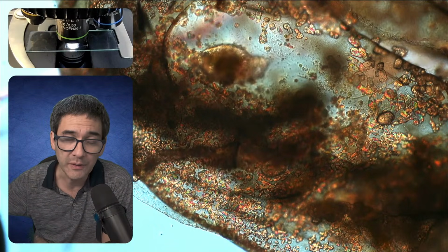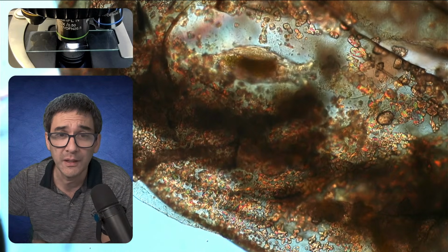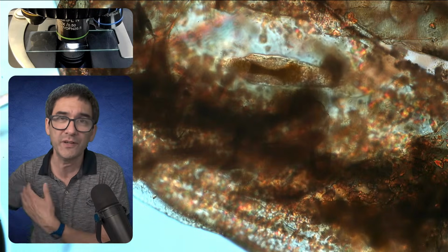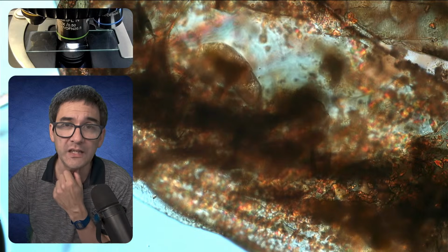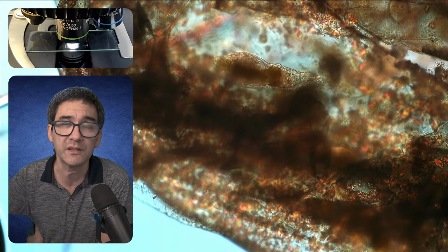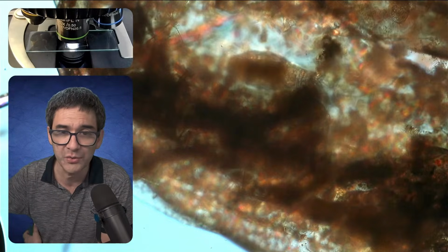I've got a camera connected, right? And the camera, of course, goes into the computer. But for normal microscopy, if I just want to quickly look at things, I always use the eyepieces. The reason is that it's a more natural way of interacting somehow, and you simply see better contrast. The so-called dynamic range of looking through the eyepiece is simply higher. So you see more details in the dark areas and more details in the bright areas if you look through the eyepieces. So for casual use, a quick check, I always use the eyepieces.